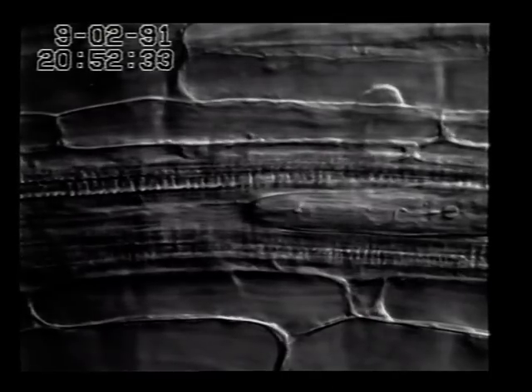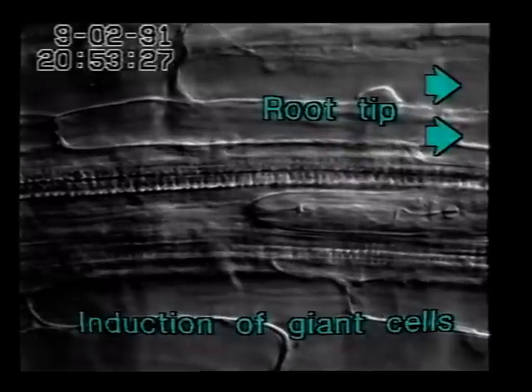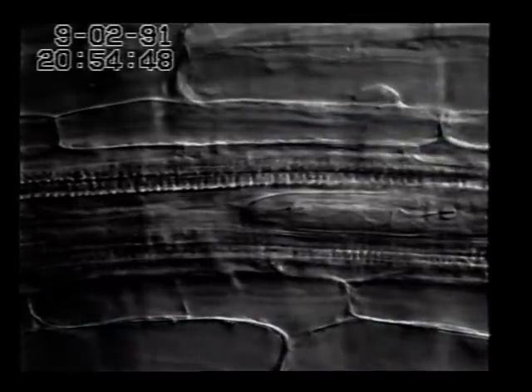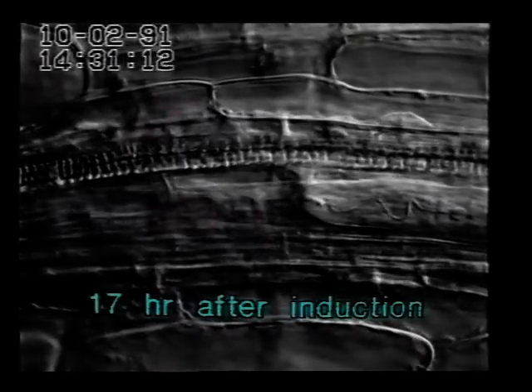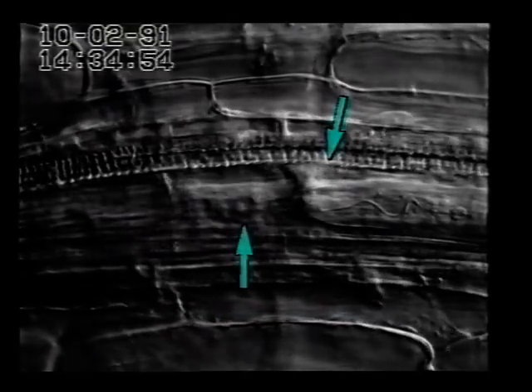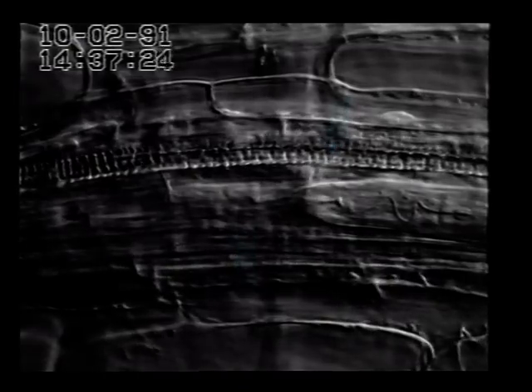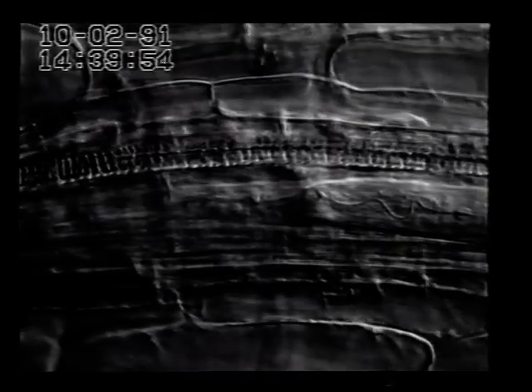For technical reasons, this and all following scenes are turned round at 180 degrees so that the root tip is at the right-hand side. The juvenile has now reached the region of the vascular cylinder, where it gradually slows down its forward migration and starts to induce the first giant cells. After about 17 hours, distinct changes within the cells surrounding the nematode's head are clearly recognizable. The cells have become multi-nucleate, with some of the nuclei indicated by arrows. The behavior of the juvenile still follows strictly the same pattern which has already been described for the process of root penetration and migration.